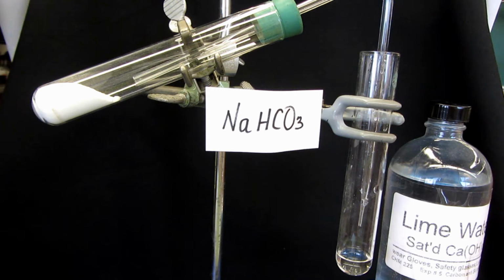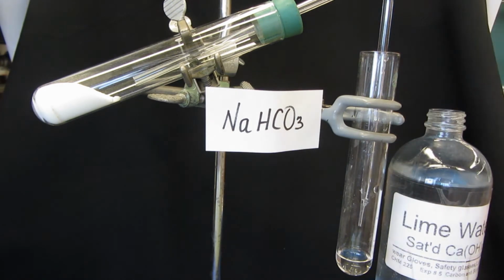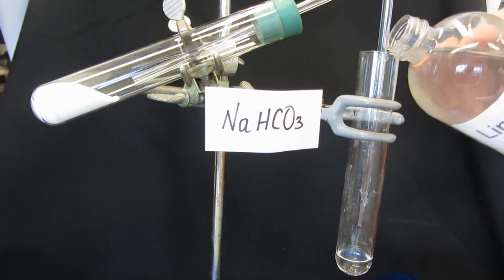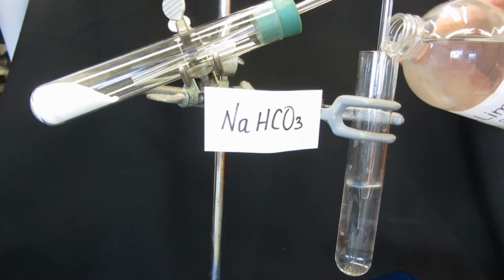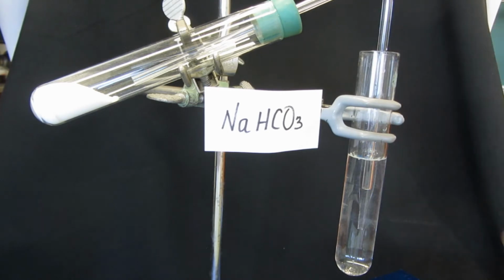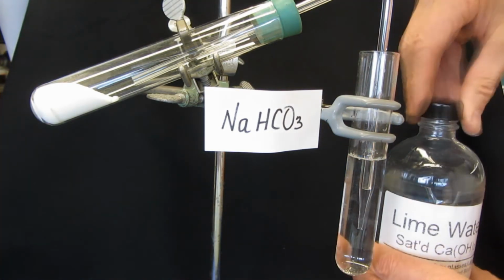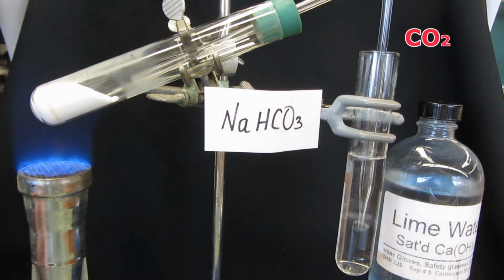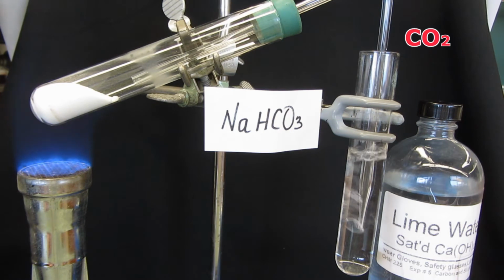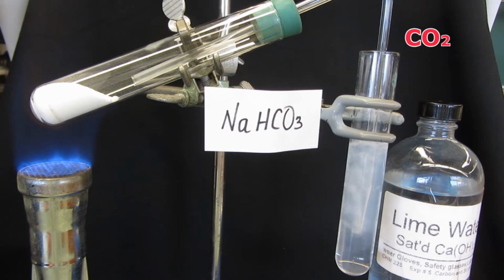Let's take a look at the decomposition of a metal bicarbonate. The test tube on the left contains sodium bicarbonate, commonly known as baking soda. In the test tube on the right, I'm adding a saturated solution of calcium hydroxide called lime water. Calcium hydroxide is a strong base, and it's used to detect carbon dioxide. When the sodium bicarbonate is heated, it liberates carbon dioxide gas, and that carbon dioxide gas is being bubbled into the solution of lime water.